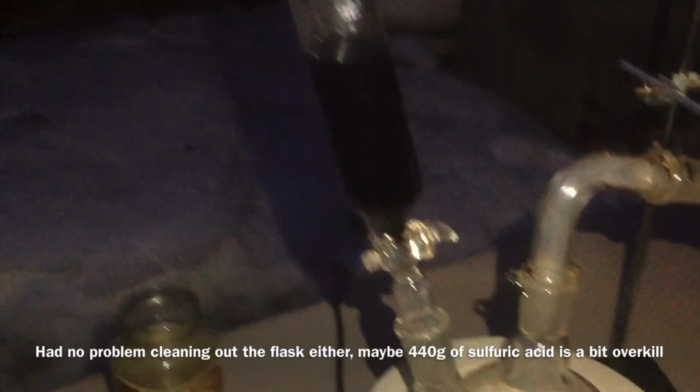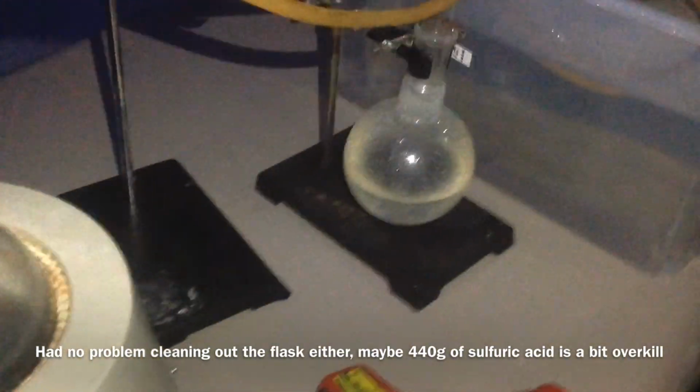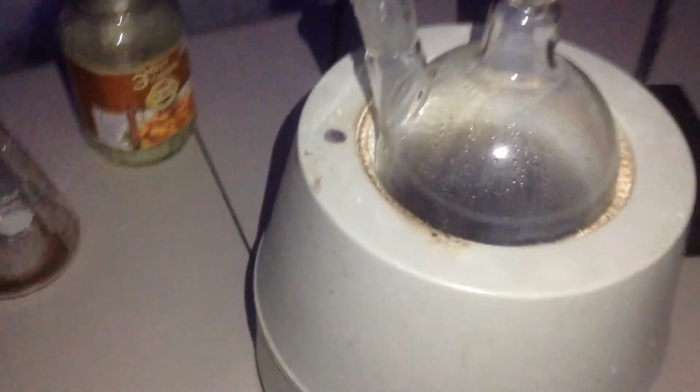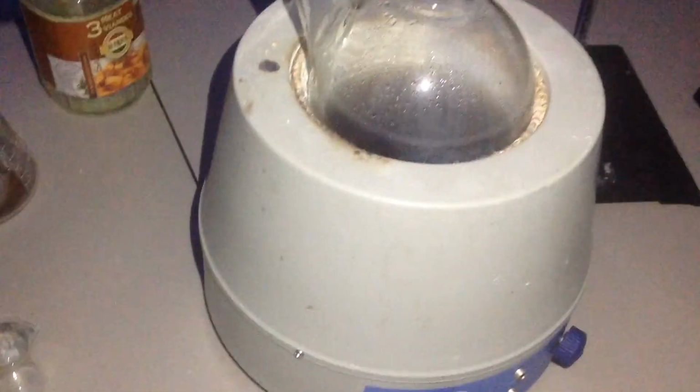I am going to use it when I redistill this, because some material did froth over, so there's probably some potassium nitrate left in there. When I redistill this, I'm going to add a little dab of sulfuric acid just to make sure everything is well reacted. And so I'm going to close this all up and put it somewhere safe. Next morning I'm going to redistill the whole thing, and I'll see you guys there.